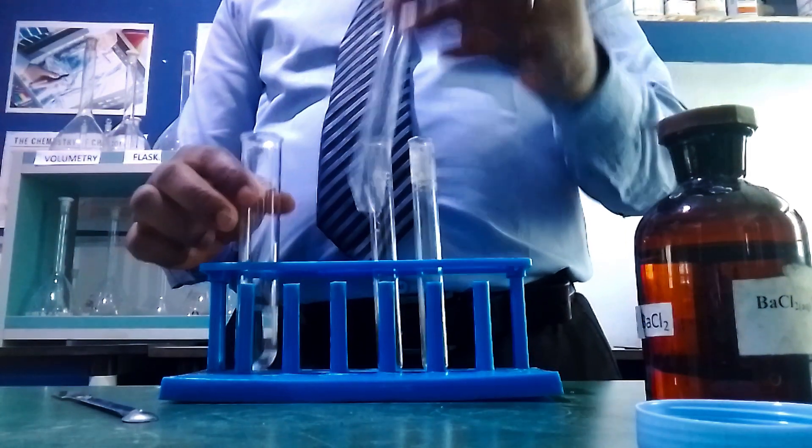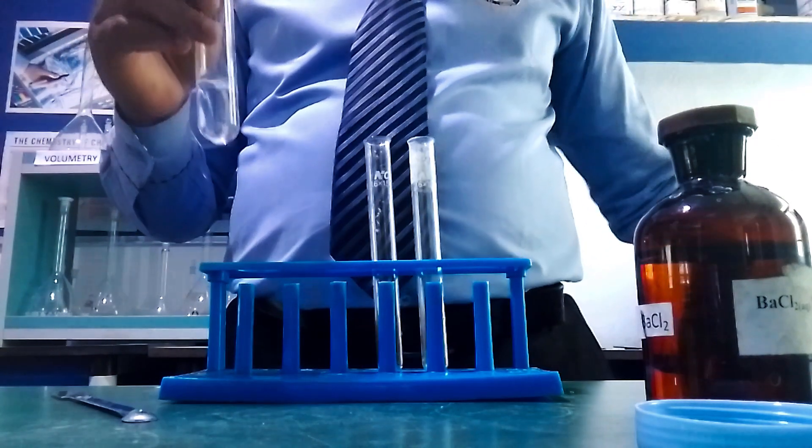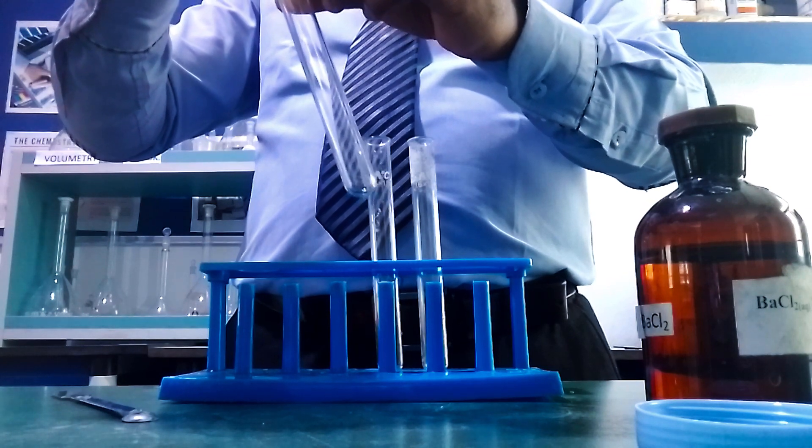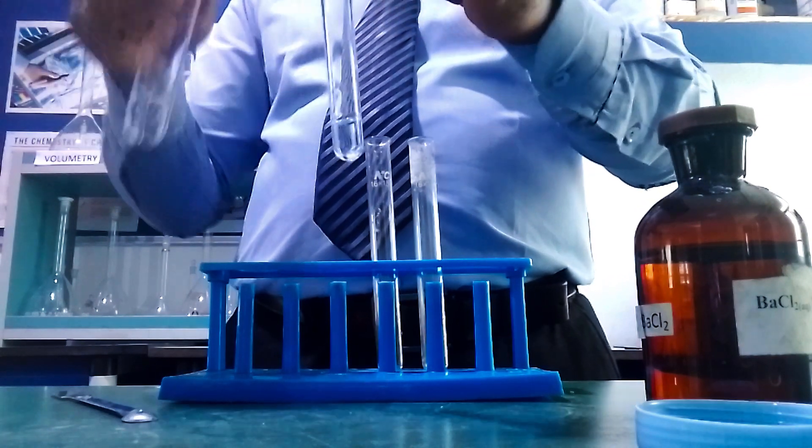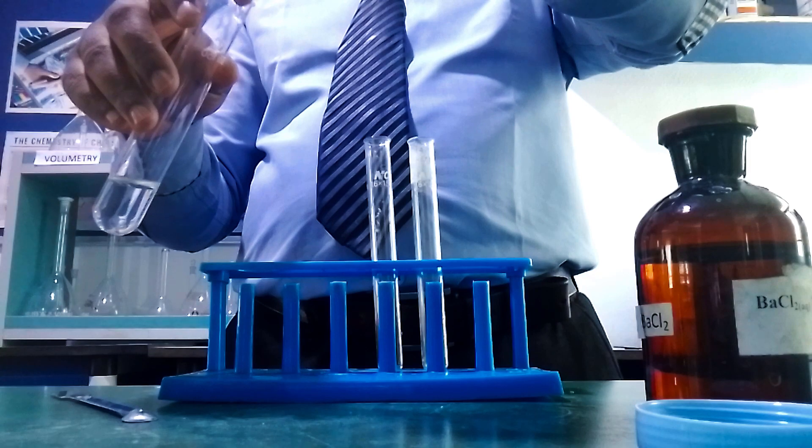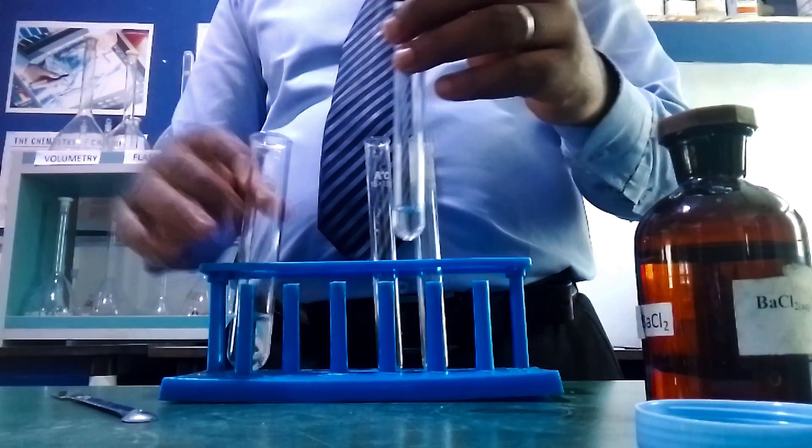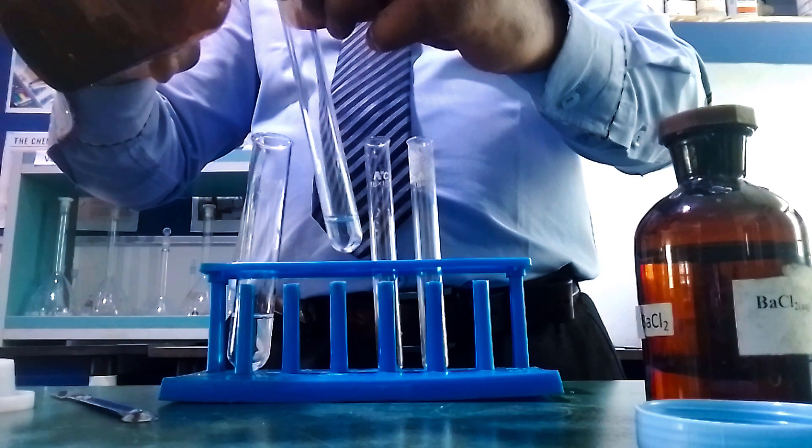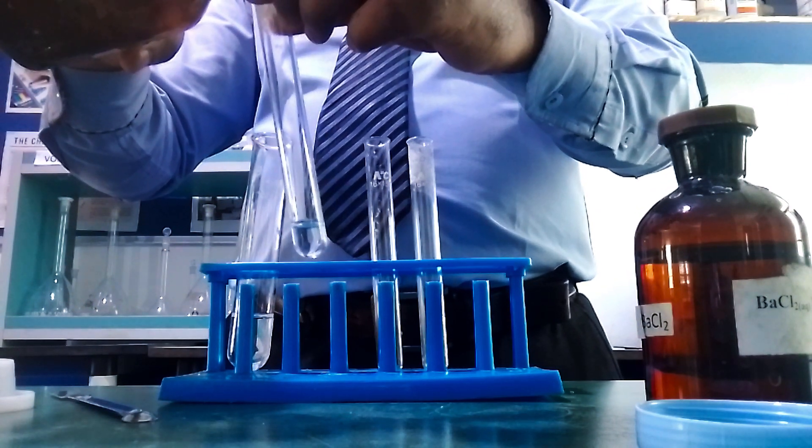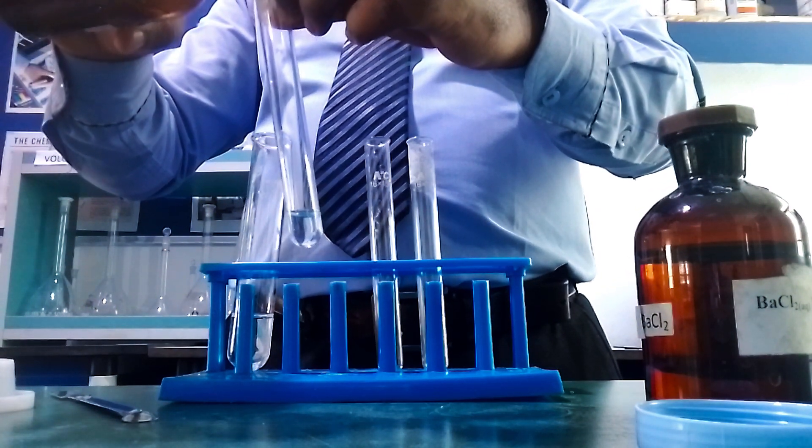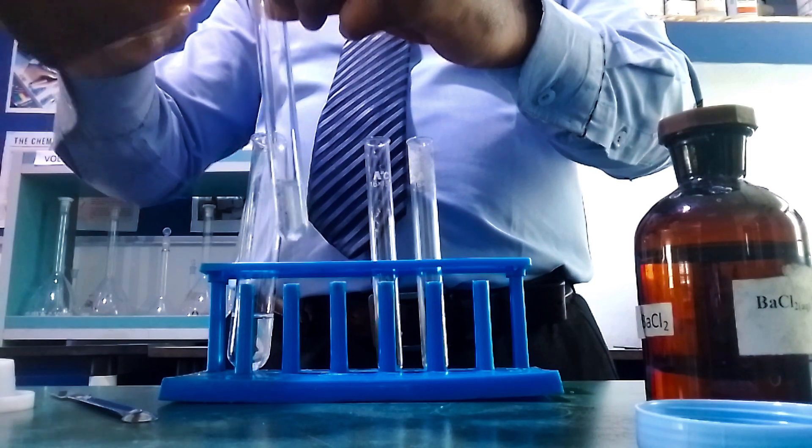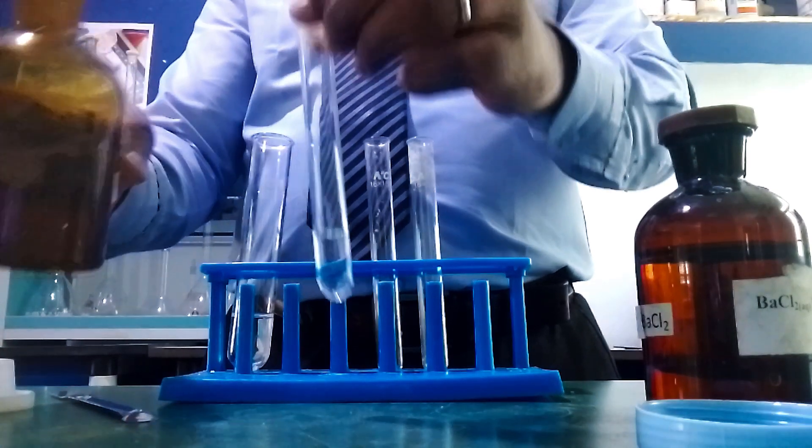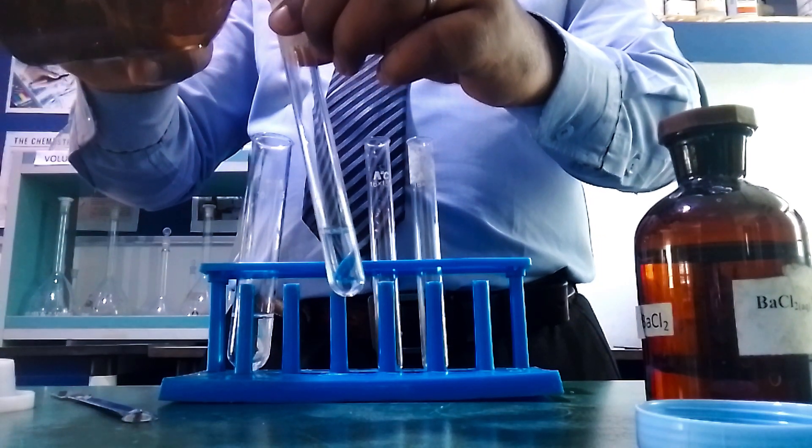Next, we carry out the test with acid. Take a little portion of the salt solution and add HCl to it, then check the observation. You can see effervescence taking place, though it's very low because we're using a solution of the salt. We observe effervescence of a colorless, odorless gas.